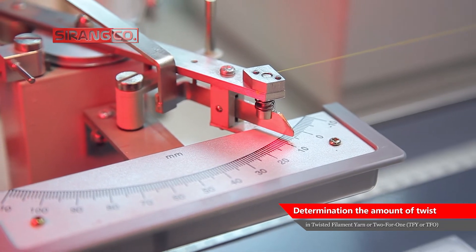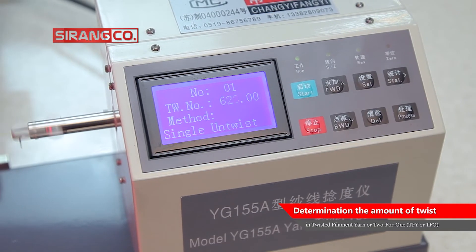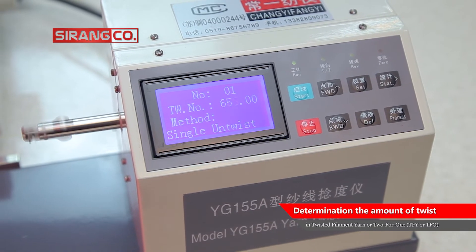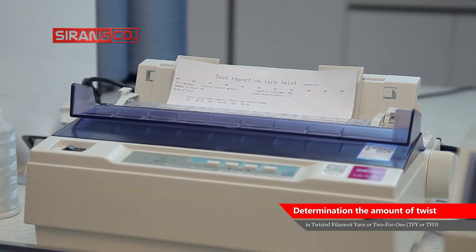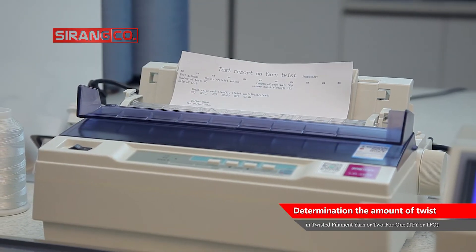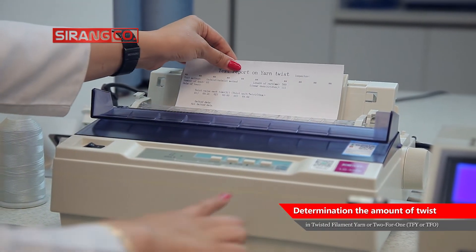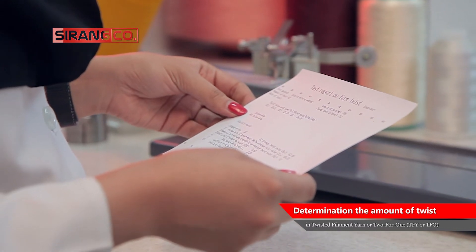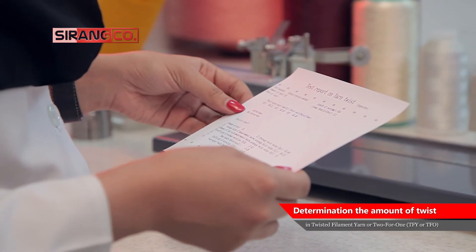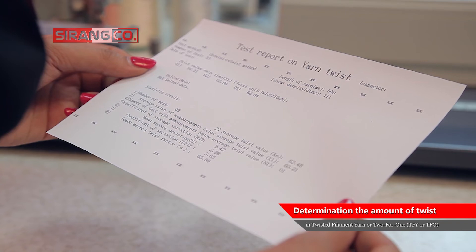The output of the device includes information such as the number of twists per meter, mean of twists, twist factor, coefficient of variation, and more, which can be viewed on the device panel and printed using a printer.